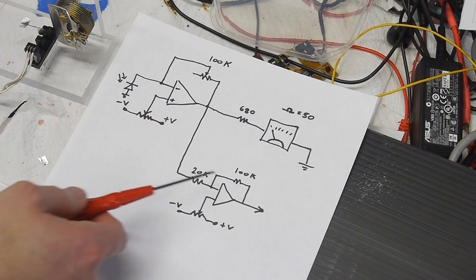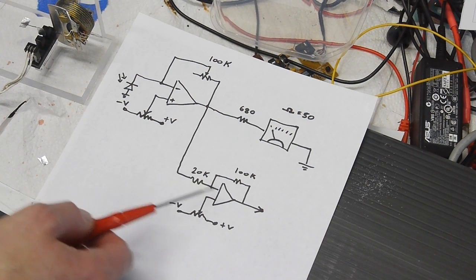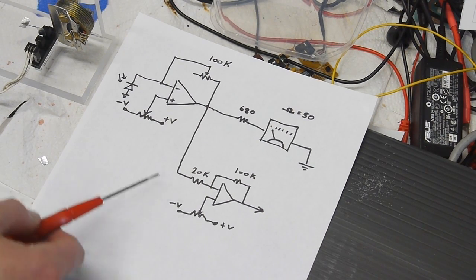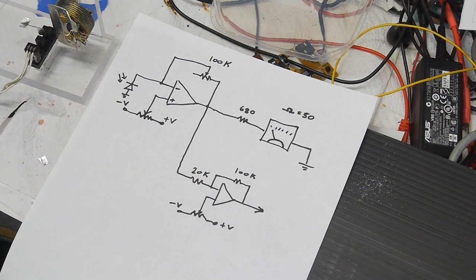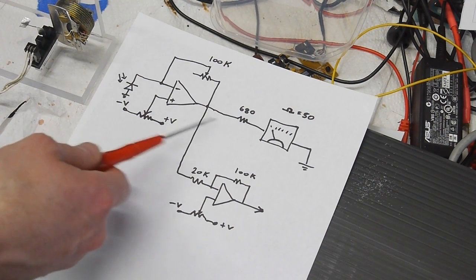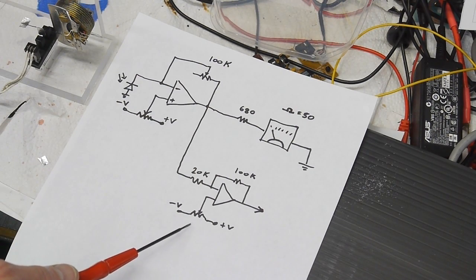And then to get even more gain, I take the voltage at this node and multiply it by -5 here, and then also get rid of the offset. So when the thing is sitting there, this thing happens to run at about -0.8 volts. So with nothing on the balance, this node is about -0.8. And just to make it easier to read that voltage and to get it closer to zero, this offset will take care of that and get another 5x gain.